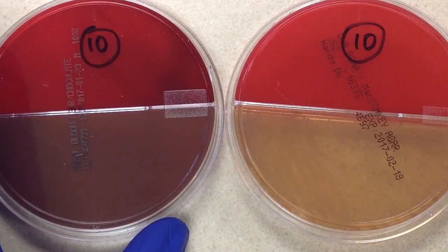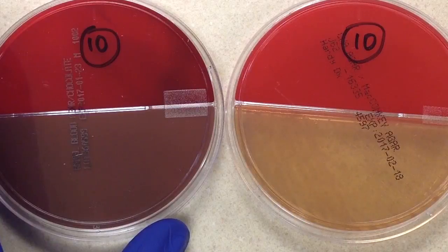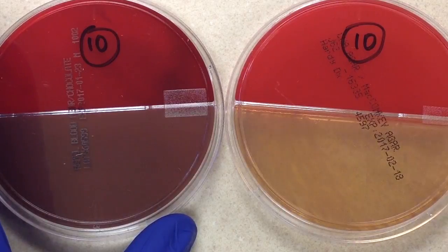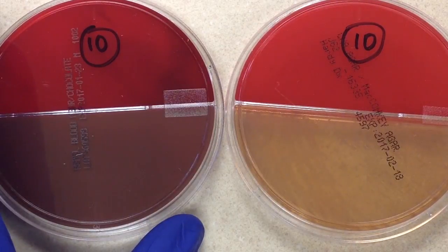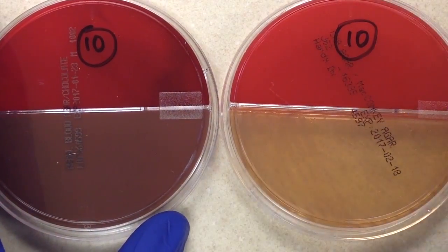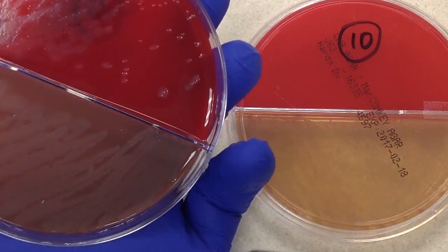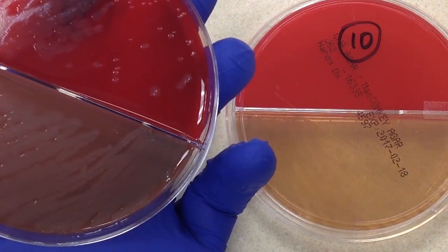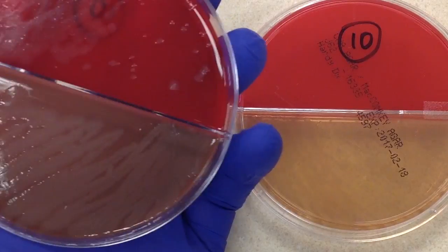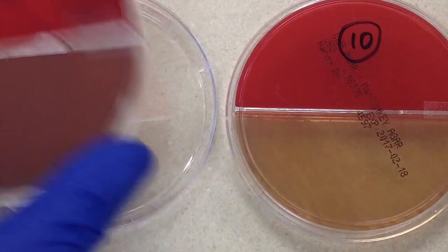Even though I list those as common pathogens, as microbiologists we always keep an open mind because really any bacteria has the potential to be a pathogen. Going back to the plates — on a culture like this we always assess whether there's normal flora, because we can almost always expect some. Looking at these two plates, I don't see any normal flora; I see just one colony type growing on both the sheep blood and the chocolate.